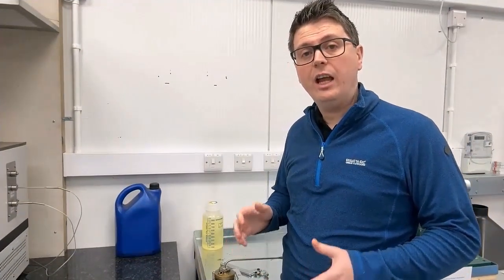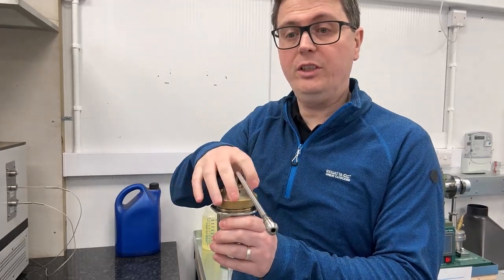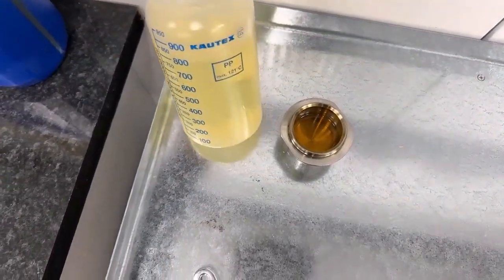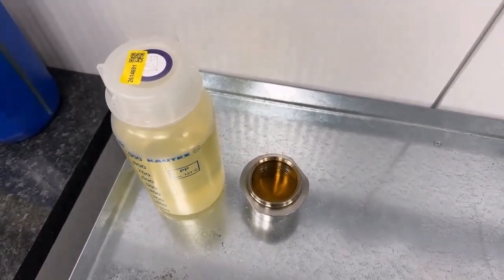The test is now finished and it's cooled down. I've just loosened off the top and cracked it open. We can see that originally the oil was a nice yellowy colour and it's now gone a dark golden colour, indicating the oil has been oxidised and has probably lost some material. We're going to weigh it now to see the findings. We've done the calculations and re-weighed the sample — the result was just under 12%, which is a really good result and consistent with what we were expecting, so the customer should be happy.